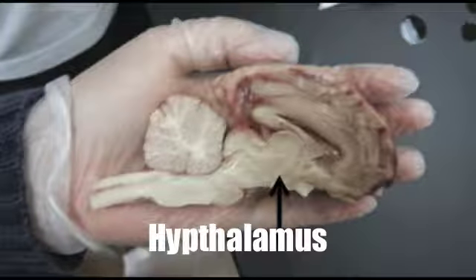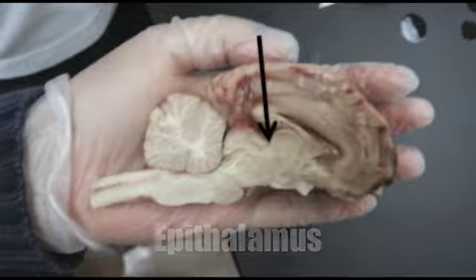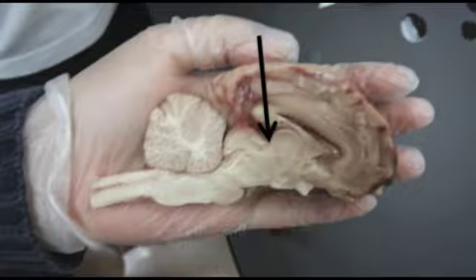The hypothalamus is a section of the brain responsible for hormone production. The hormones produced by this area of the brain govern body temperature, thirst, hunger, sleep, and the release of other hormones in the body. The epithalamus connects the limbic system to the other parts of the brain. Functions of this component include the regulation of emotions and motor pathways, and the secretion of melatonin by the pineal gland.